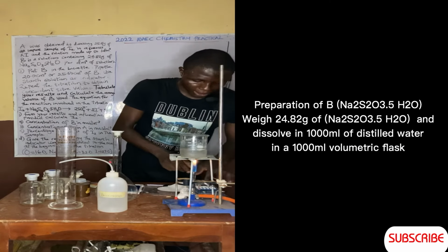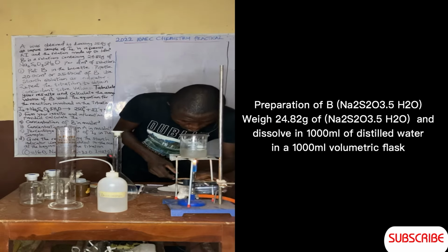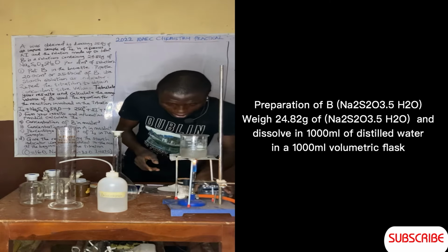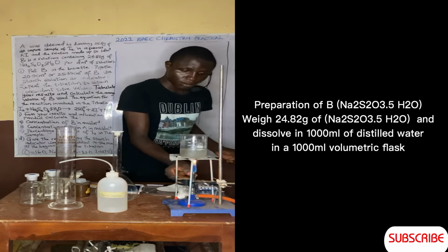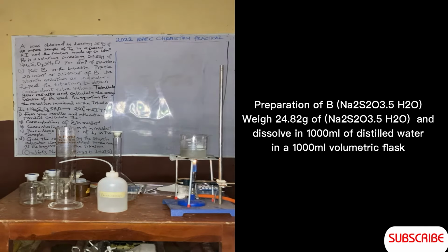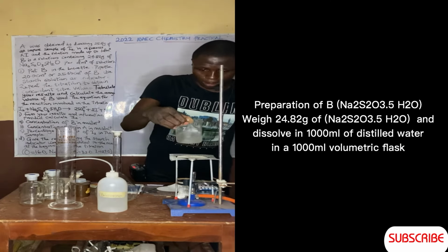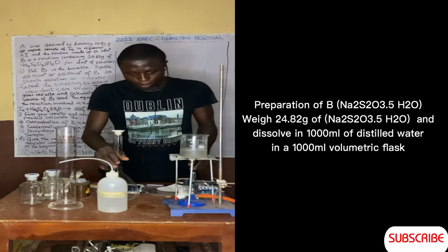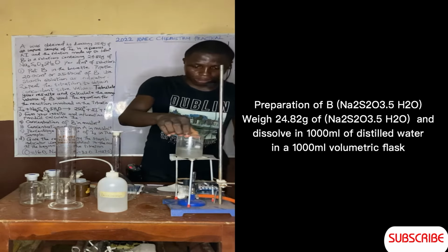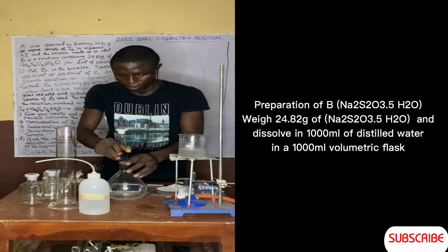So that's that. It was 18 minutes before, so we have less than 1 minute to make this one work. So let's shut this down. So that's that. So here's our starch. We allow it to cool to room temperature. So that's our starch. Now let's dissolve this.